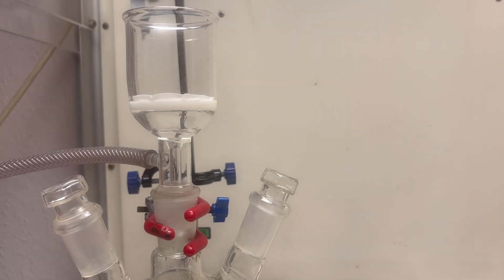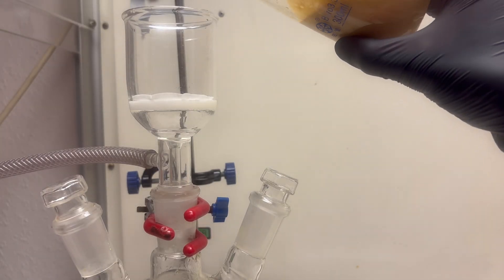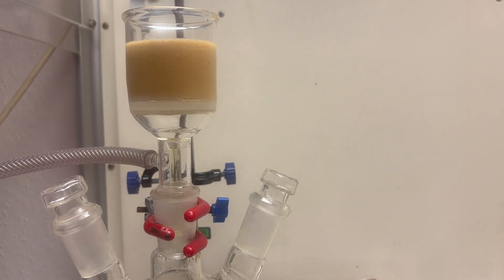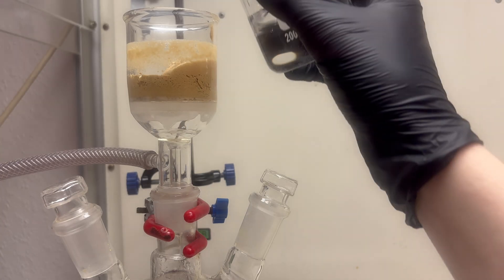The phenylhydrazine hydrochloride will be filtered in my vacuum filter and then will be washed two times with some additional hydrochloric acid.